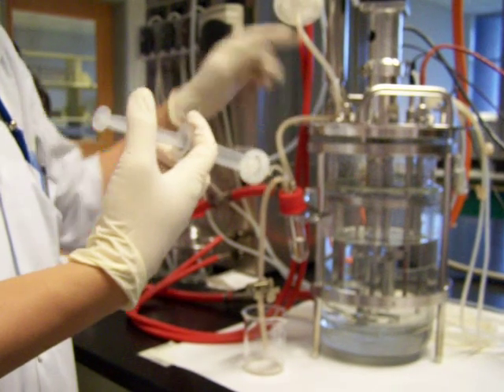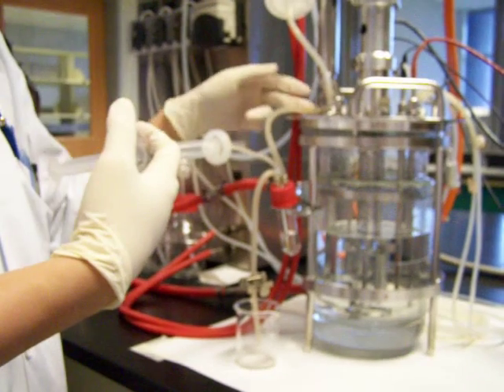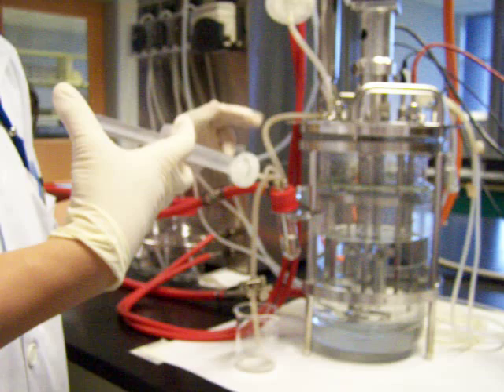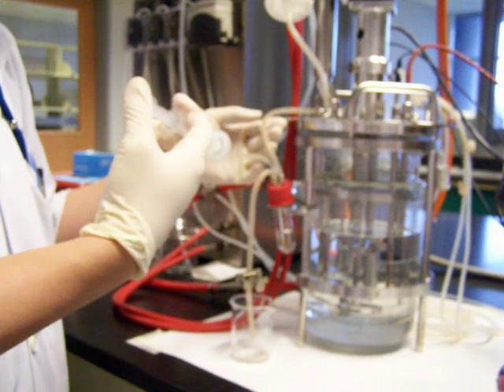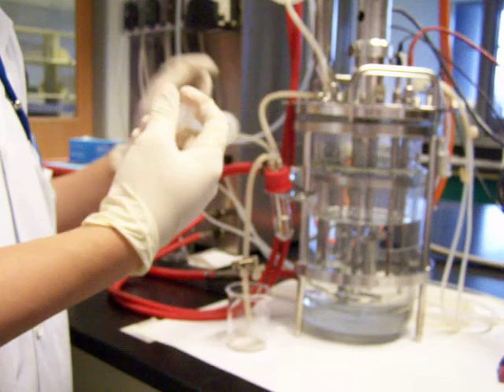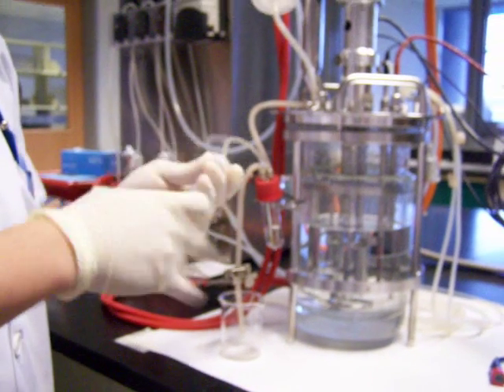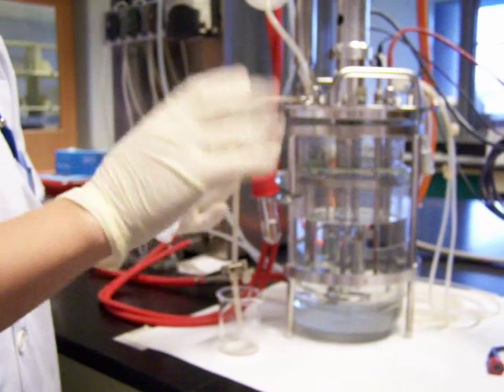Now you can't see properly because there will be some culture stuck here. You don't want to interfere with your next reading, so you push back your syringe. All the air that's going to push back is filtered through with a filter.